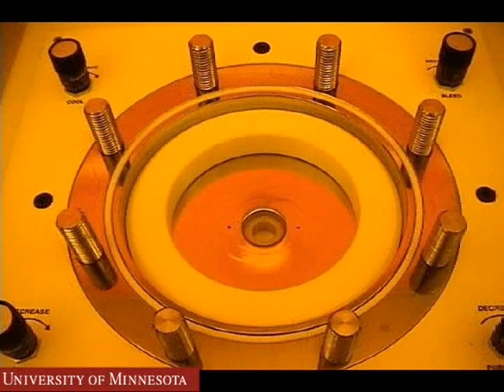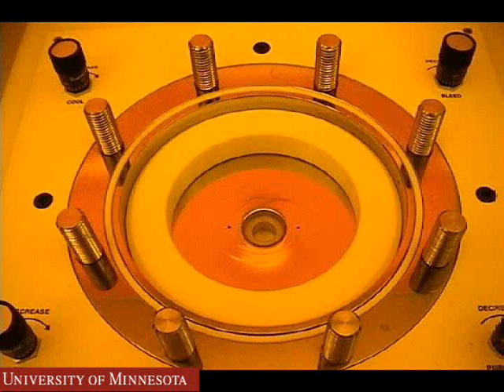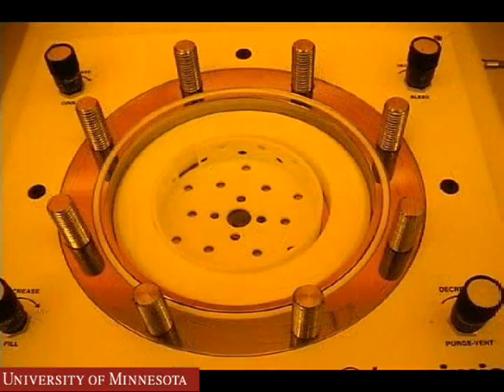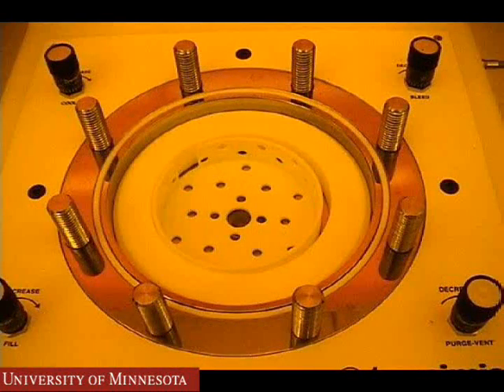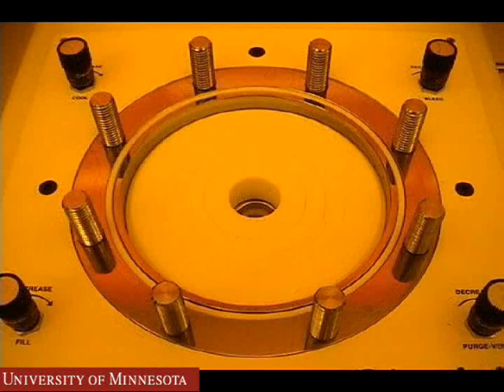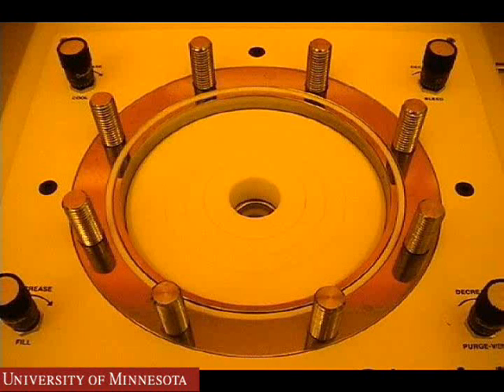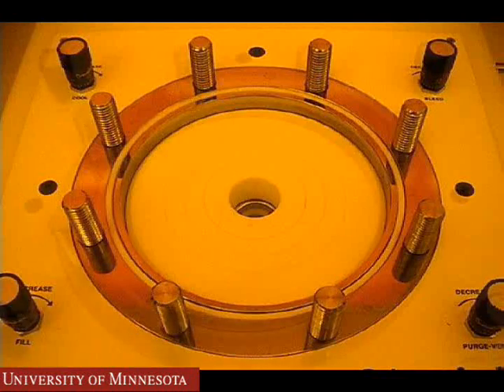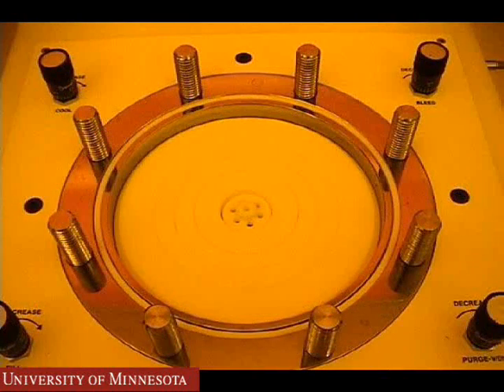This is an example of the four-inch wafer insert with a four-inch wafer holder inside of it. The total chamber volume has been reduced. The next images show all the wafer inserts inside the chamber with the piece holder in the center. The chamber volume has been reduced to a bare minimum.